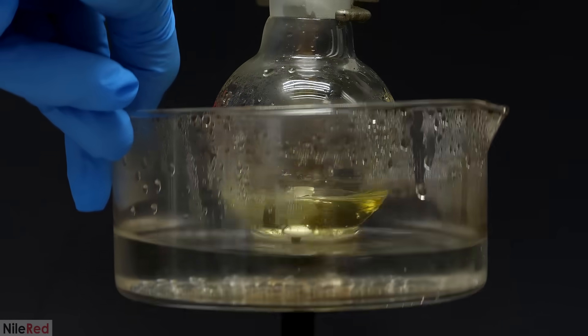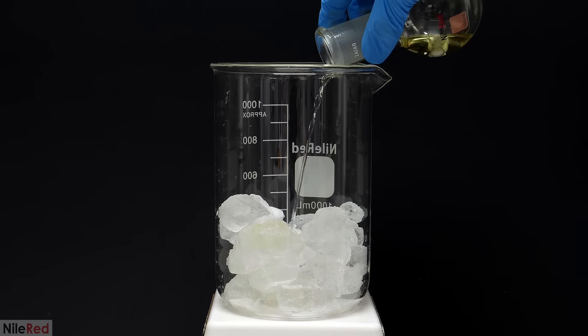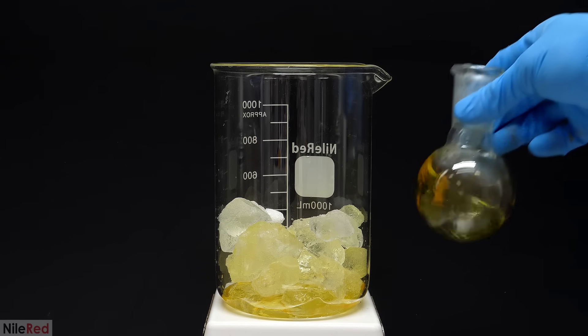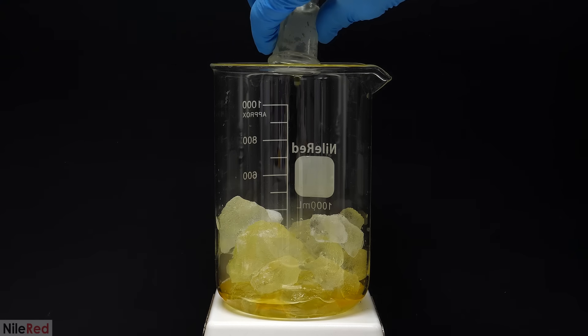When it was done, I took away the water bath, and I let it cool a bit. Then, I poured it into about 200g of ice. I also used a small amount of water to wash the flask, and I dumped that in as well.